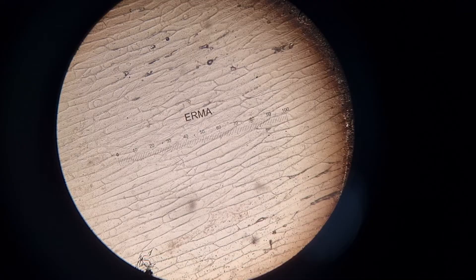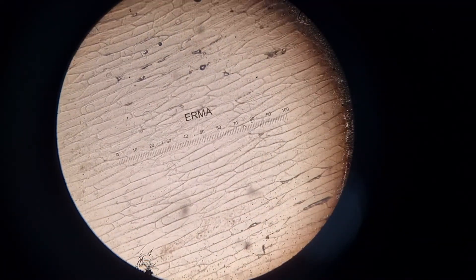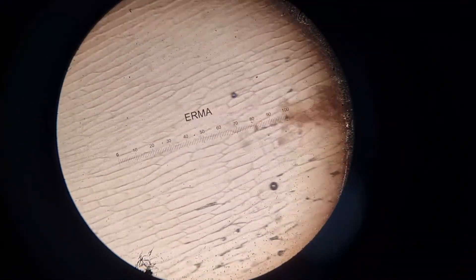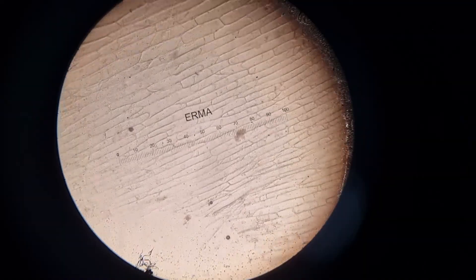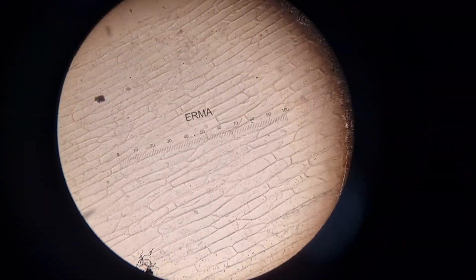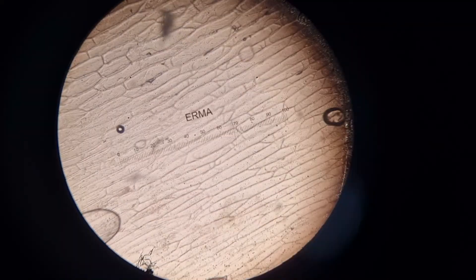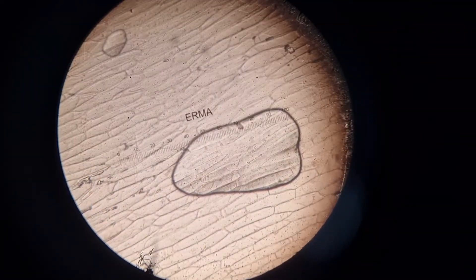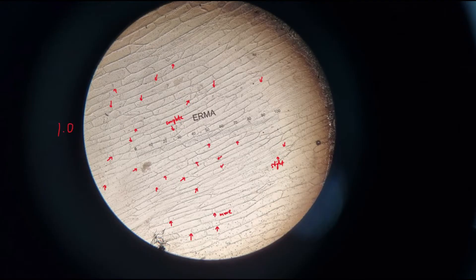Here is a clip of me looking at it under the microscope. You'll notice this brick-like arrangement of onion epidermis cells — these are the individual cells we're looking at. I'm using 10x magnification. You'll also see some dark areas — those are air bubbles, just ignore them. This is my result for 1 mol per dm³.